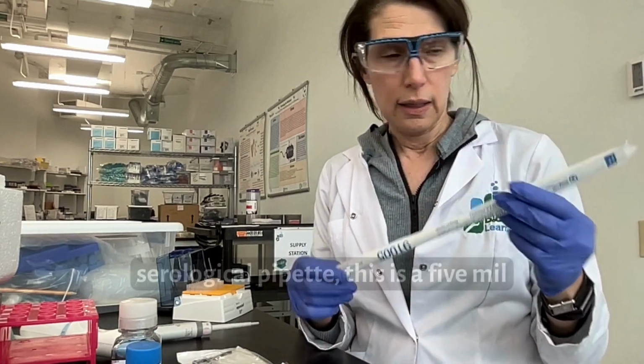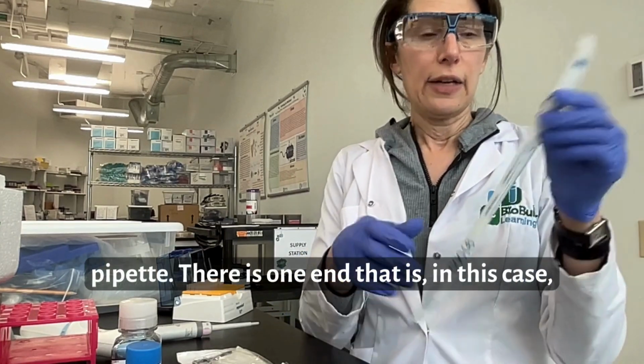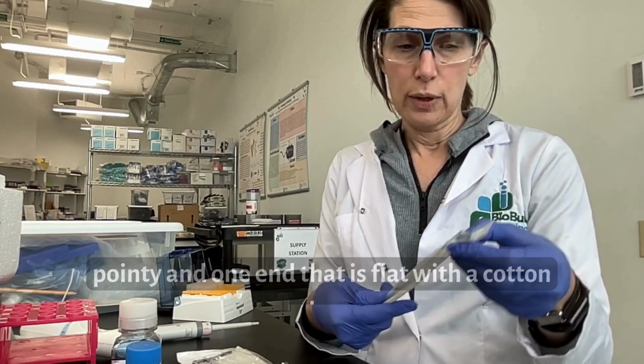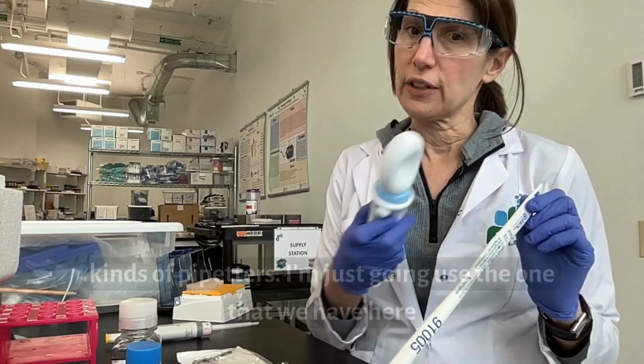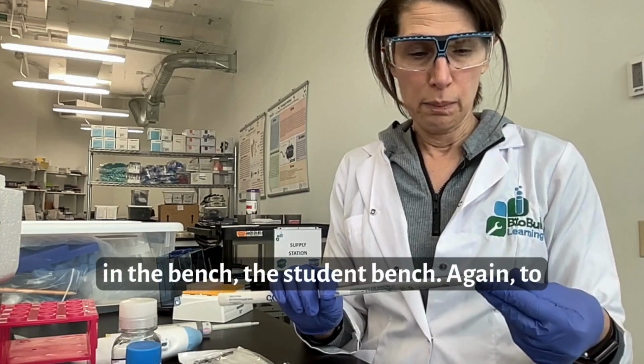Similarly, with the serological pipette, this is a 5 ml pipette. There is one end that is, in this case, pointy, and one end that is flat with a cotton plug. That flat cotton plug end goes into our pipetter. There are lots of different kinds of pipetters. I'm just going to use the one that we have here in the bench, the student bench.